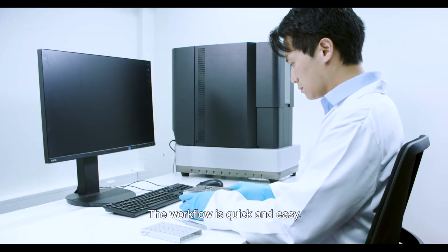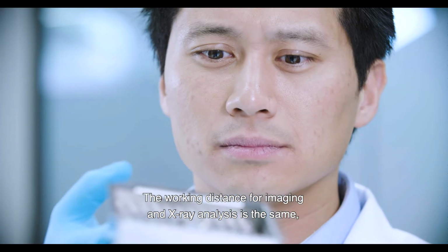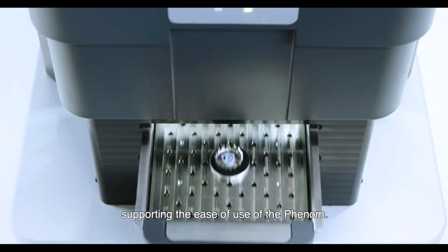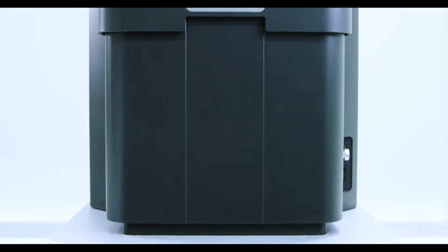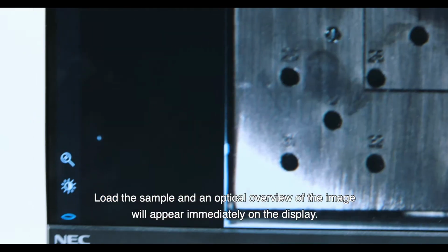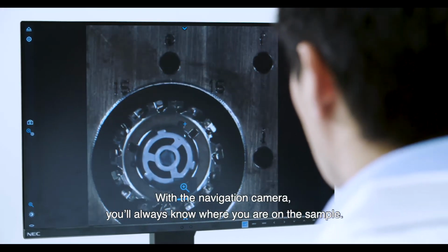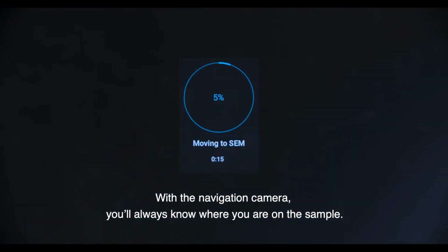The workflow is quick and easy. The working distance for imaging and X-ray analysis is the same, supporting the ease of use of the Phenom. Load the sample, and an optical overview of the image will appear immediately on the display. With the navigation camera, you'll always know where you are on the sample.